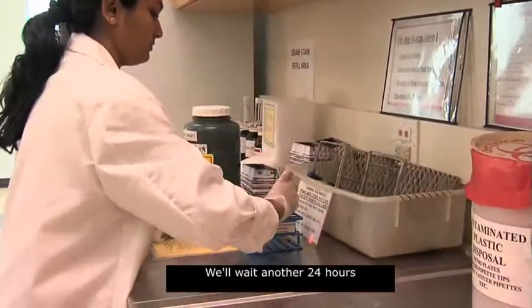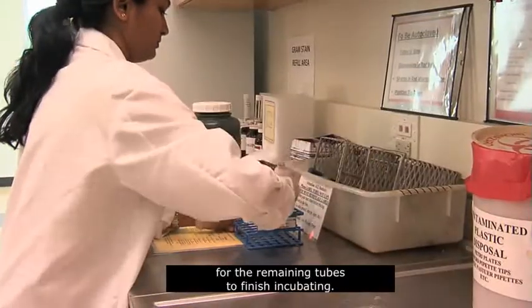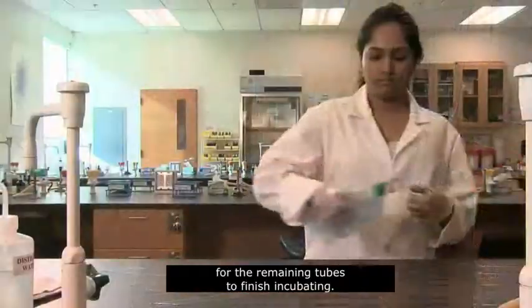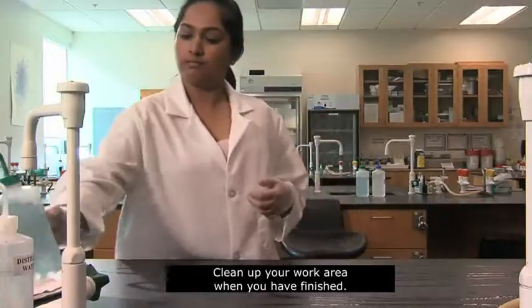Properly dispose of these tubes now that their results are recorded. We'll wait another 24 hours for the remaining tubes to finish incubating. Clean up your work area when you have finished.